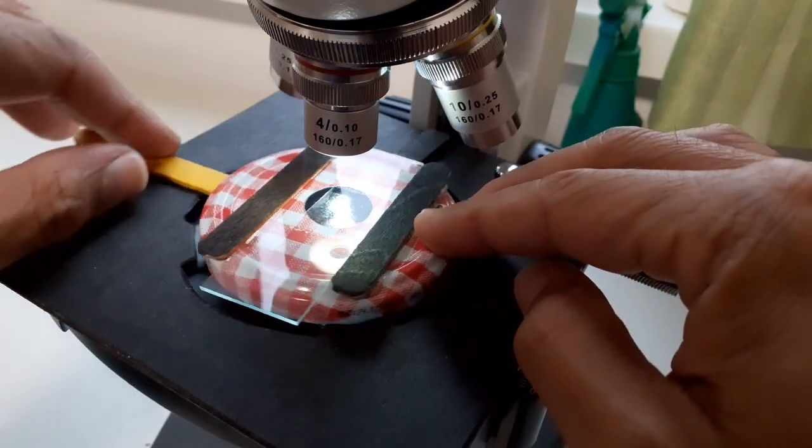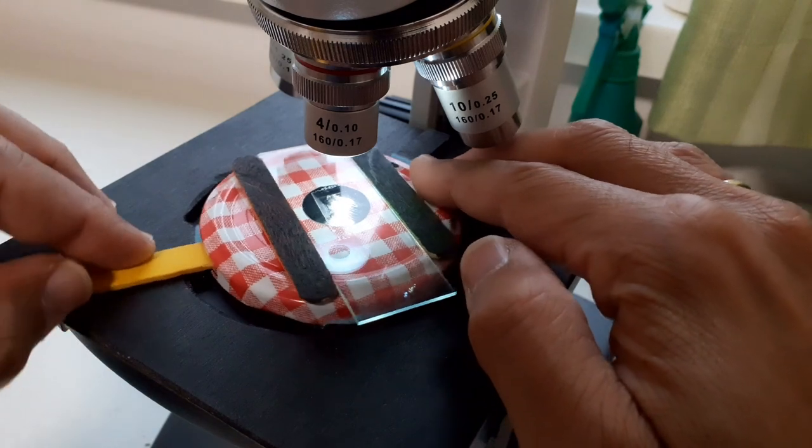Hi, MicrobeHunter here again. Today I want to talk about polarization microscopy and specifically show you an improvised method and how you can make yourself a rotating stage for polarization microscopy.